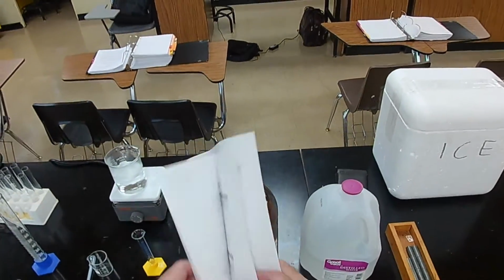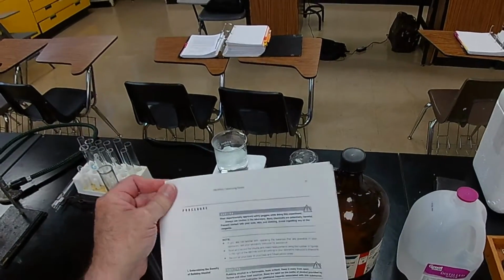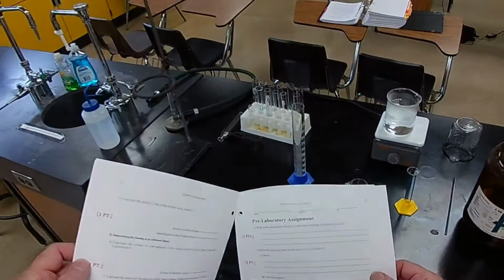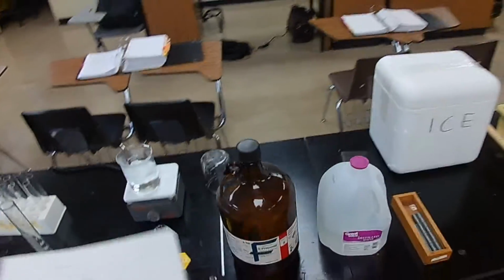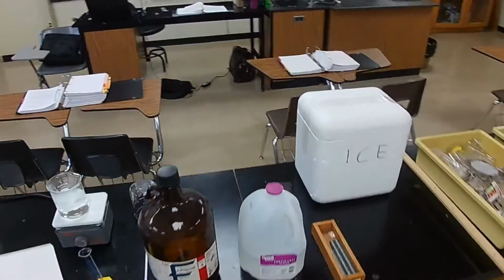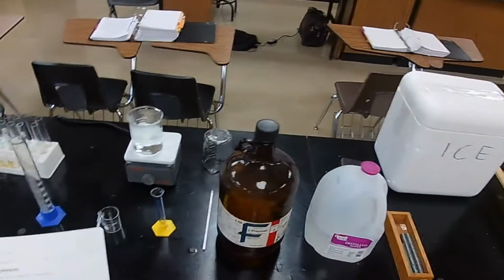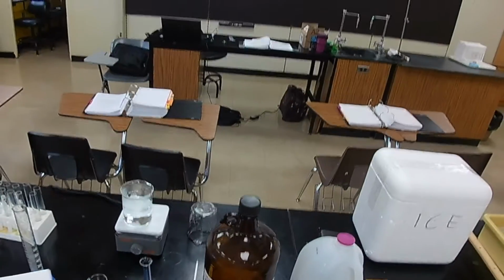All right, so here's what we're going to do. First, we're going to find the density of the liquid. Safety factors. Let's go back to the back page, pre-laboratory assignment. All right. So what safety precautions should you take when working with rubbing alcohol, 2-propanol? Well, you don't want to get any of it in your eyes. Of course, you want to cover your eyes, splash protection. This pure stuff might be irritating to some people, so you want to wear gloves, and I'll put my gloves on in a second.